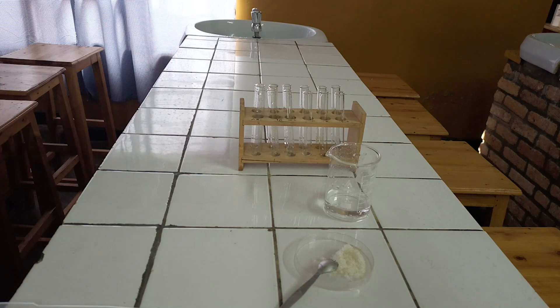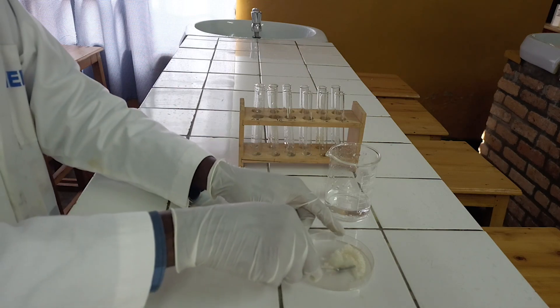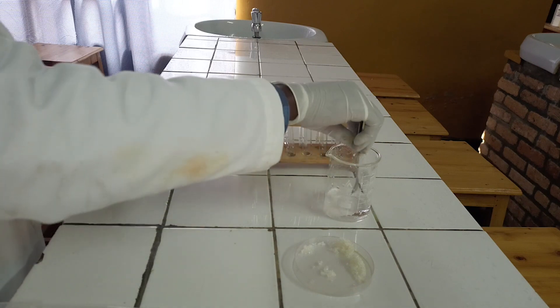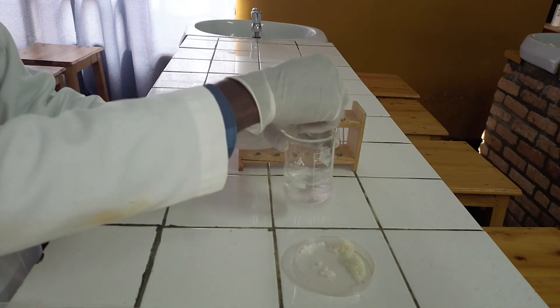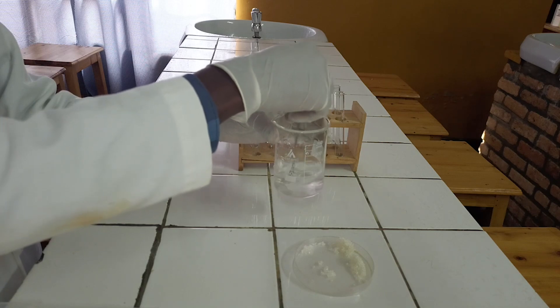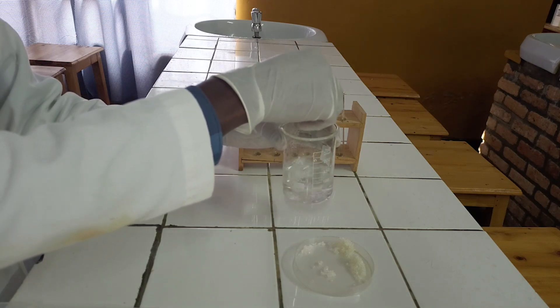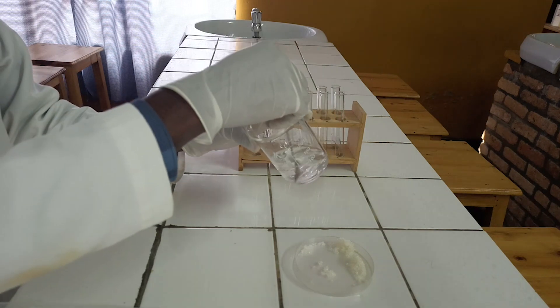First step is observation. Salts of calcium ion are white. Second step: dissolve one full spatula of salt in 50 milliliters of water. When salts of calcium ion dissolve in water, they form a colorless solution.